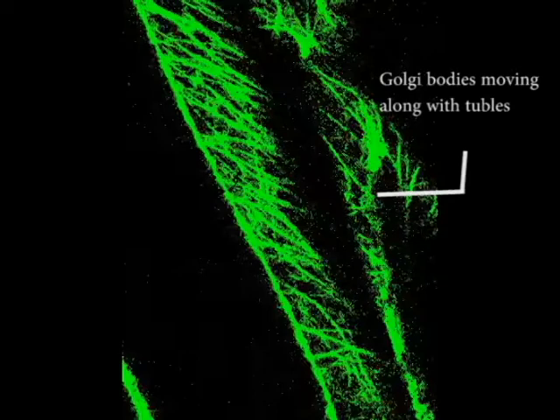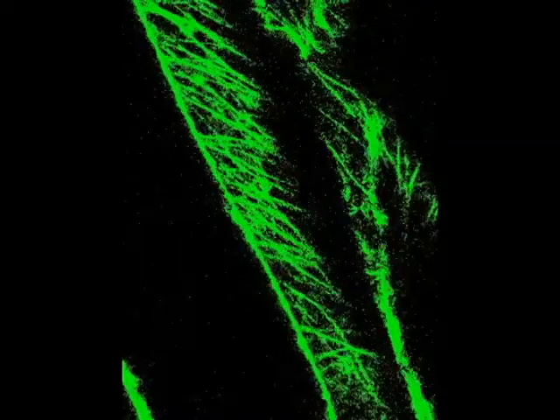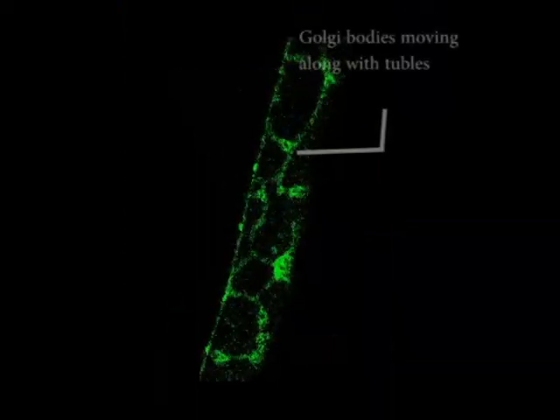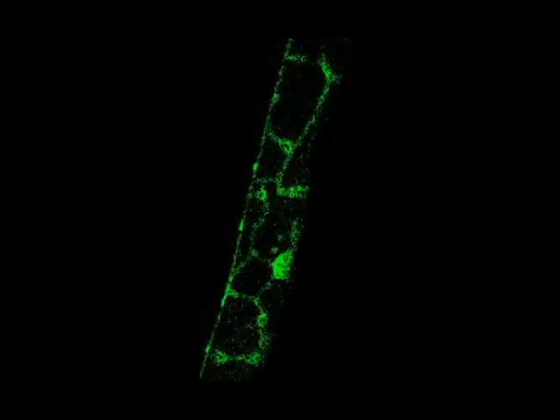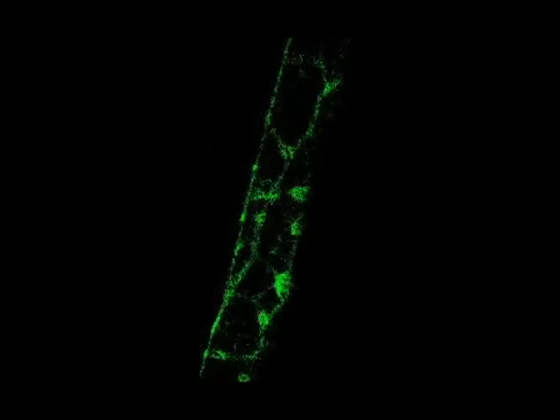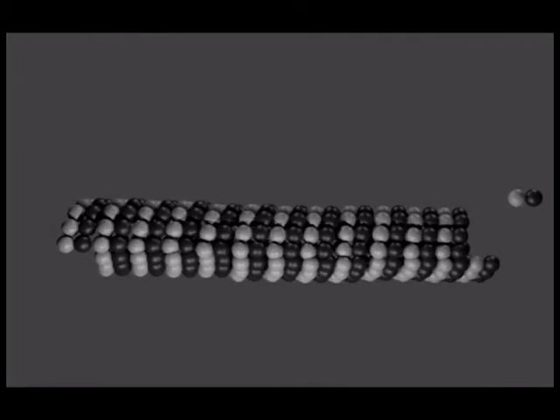Here we have more tubulin filaments, and you'll notice off to the right there is some movement of Golgi. Here's another section of filaments with more obvious moving of Golgi bodies. Now let's take a closer look at how tubulin works.